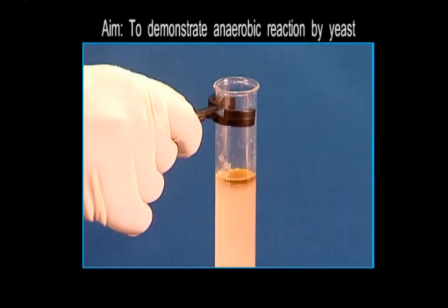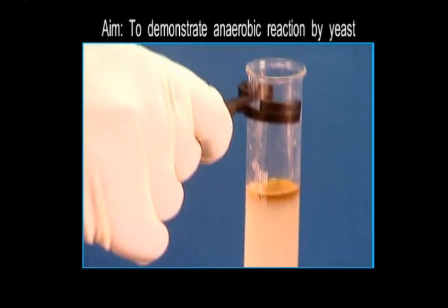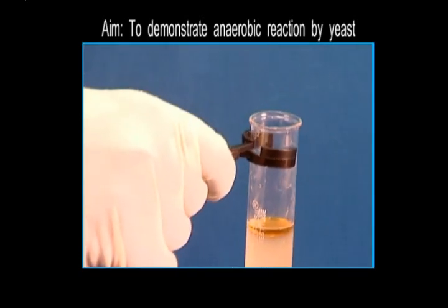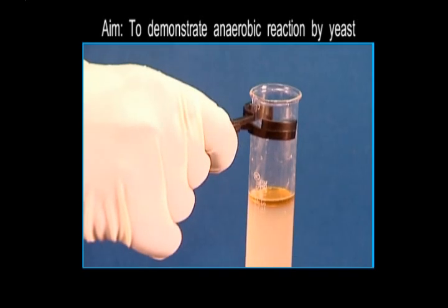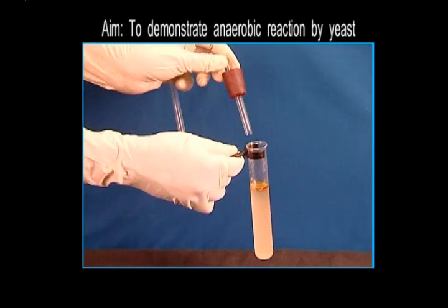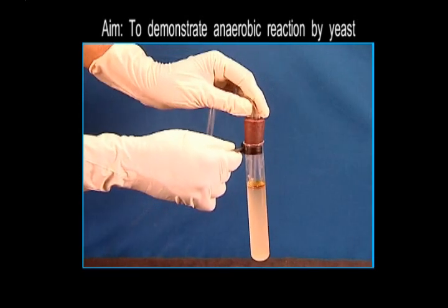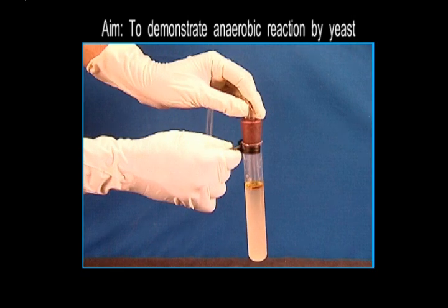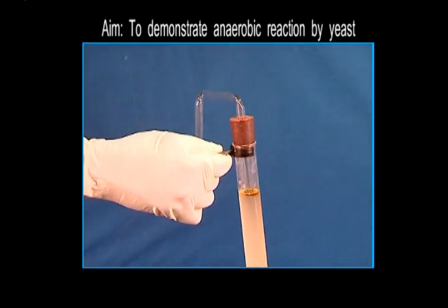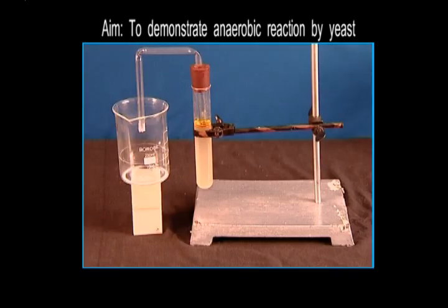This is done to prevent the solution from coming into contact with air. Next, we'll insert a thin glass tube bent twice at right angles in the test tube through a rubber stopper.